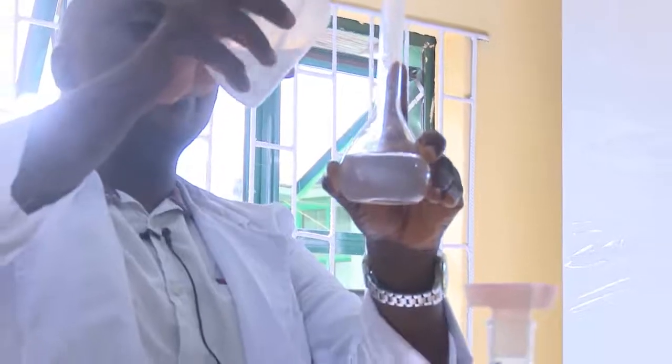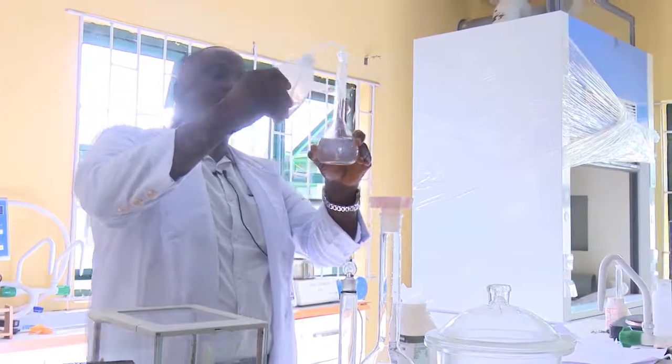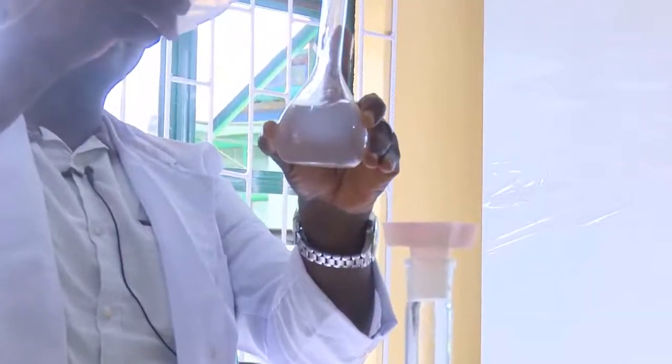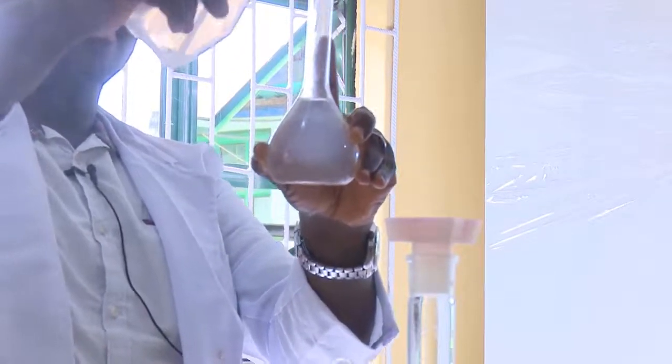That is, when we get to this place, that means we now have 250 mL in this. Now, there is one mistake that students normally make in the lab. When you are doing this preparation, you are not to do the dissolution inside your standard volumetric flask. You are to do it in your beaker. After doing it in the beaker, then you introduce the mixed salt and the solvent inside your standard volumetric flask. Okay, so we are there. That is at the 250 mark.